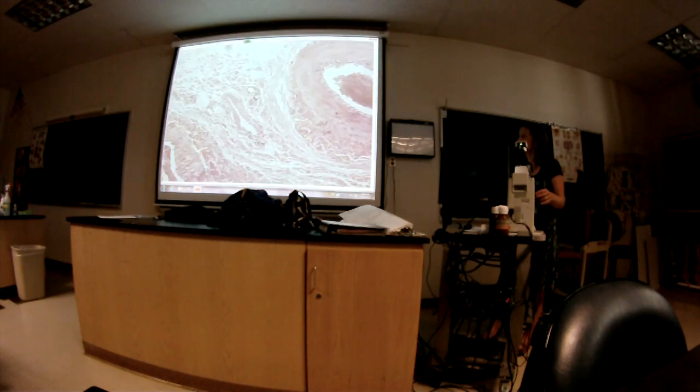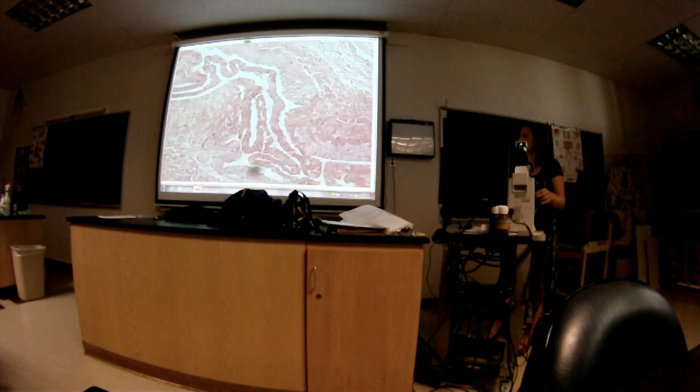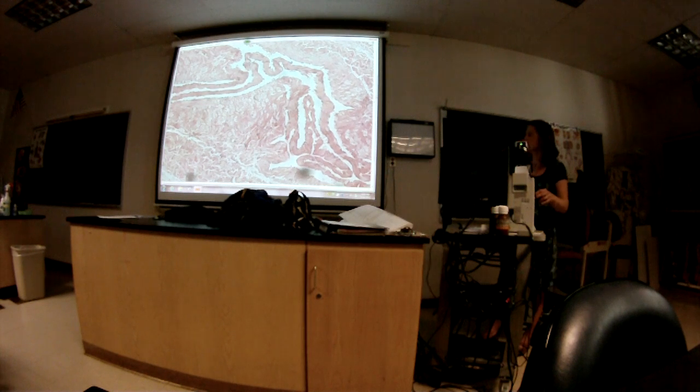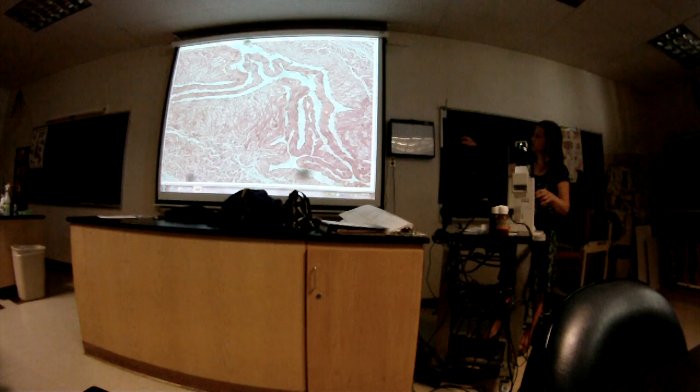You had your vein over here. Hard to identify. Yeah, tough for the layers, but that's kind of what happens when veins are sectioned. Where are the veins? This is the vein here. It's just collapsed. It has collapsed and the wall separated away. So this is the media layer. It's separated away from the adventitia. That's what happened. All right. So then we're on question 8, right?